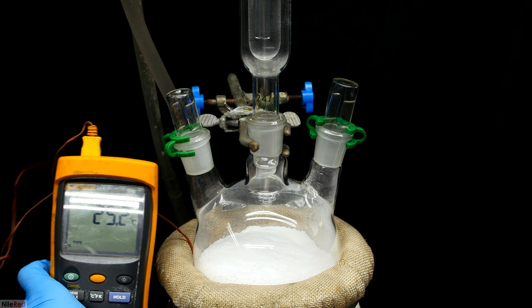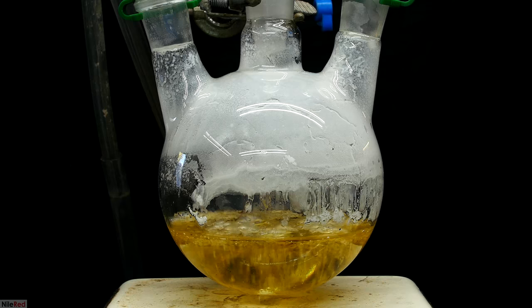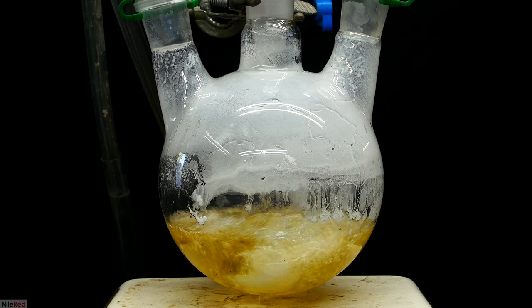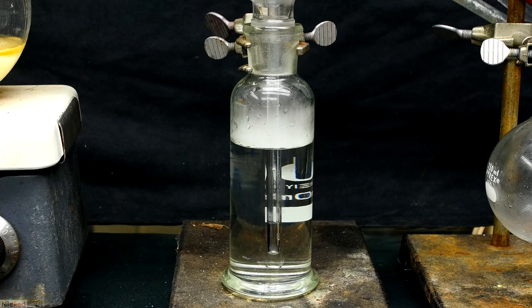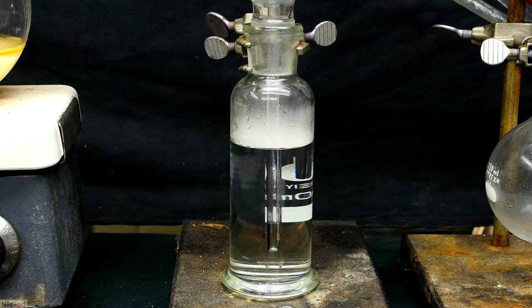Today I'll be making some trimethylamine. The stench of trimethylamine is often associated with the decomposition of plants and animals, and especially that of fish. It can contribute to the smell of bad breath and to some bacterial infections like bacterial vaginosis.